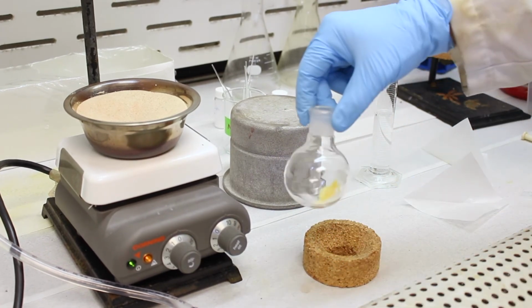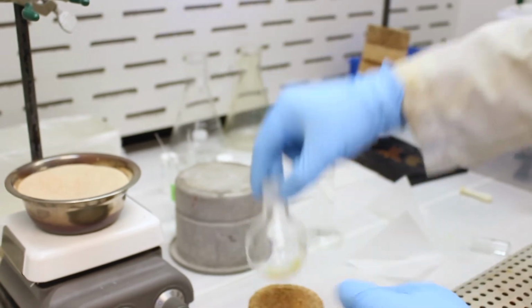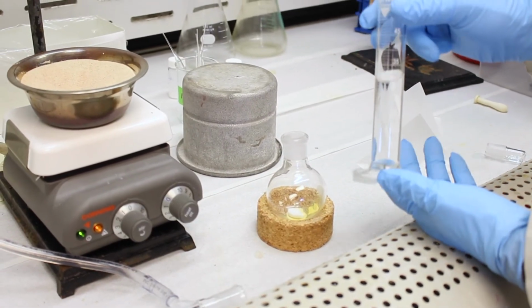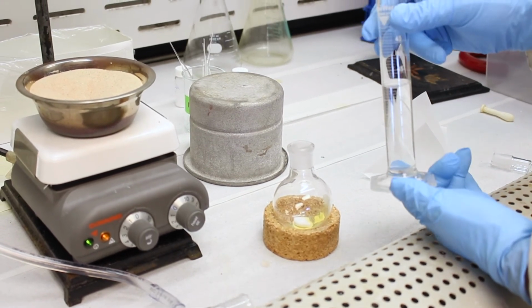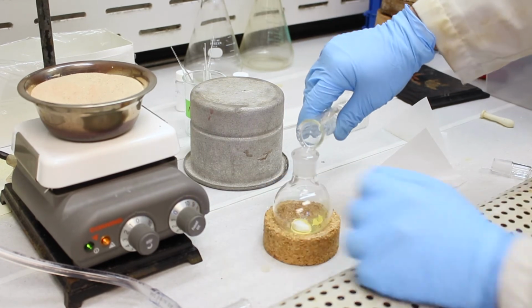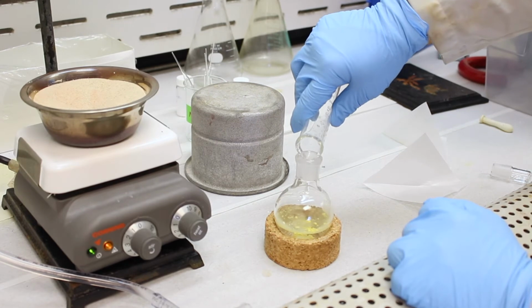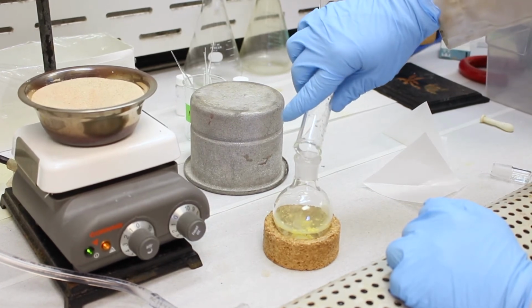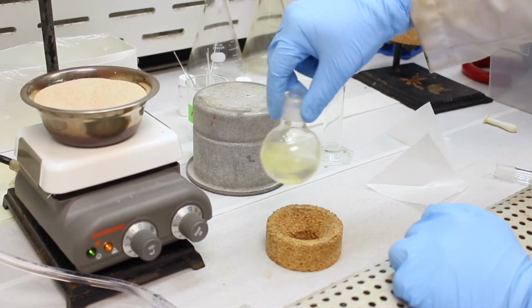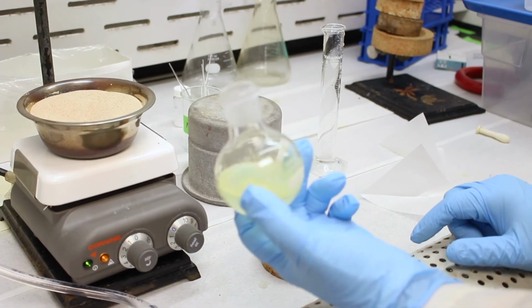Okay, so we've added our powders to the flask. We have a stir bar for stirring, and now we're going to add 30 milliliters of water. I believe the actual procedure specifies 40 mils, but we found that you get a little better mixing with 30 milliliters, so we're going to try that here. As we noted before, these two compounds are insoluble in water, even though the solvent is water. And that's what the reaction will be taking advantage of, the hydrophobic effect.